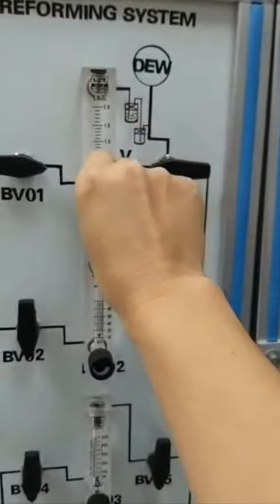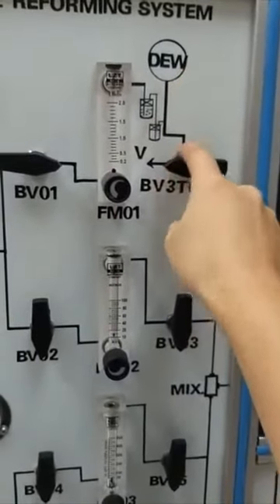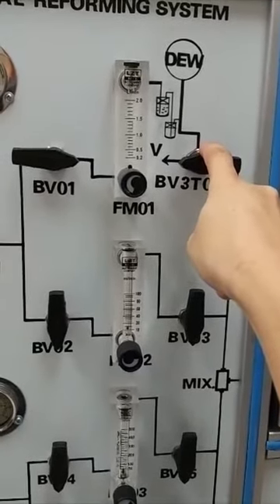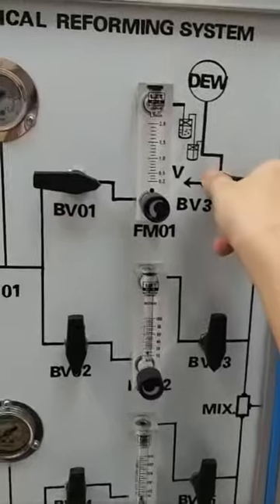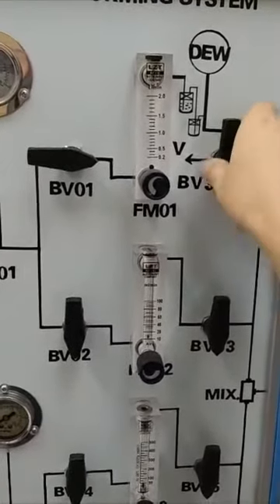Follow your experimental design. The dew meter will indicate the real dew point. You can transform the dew point into the concentration of the steam. This steam supply can also be supplied by a steam generator.